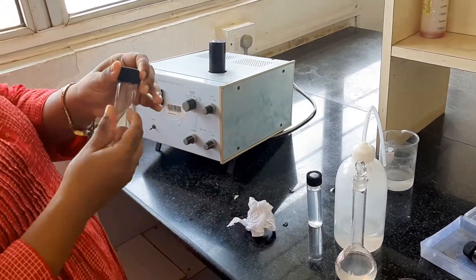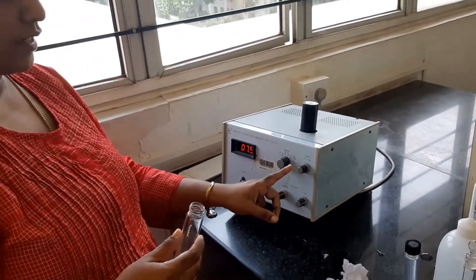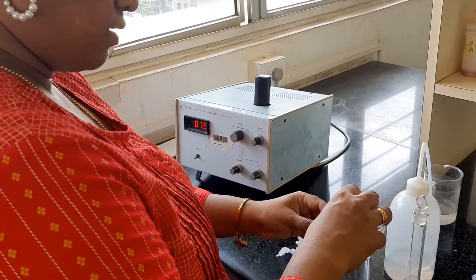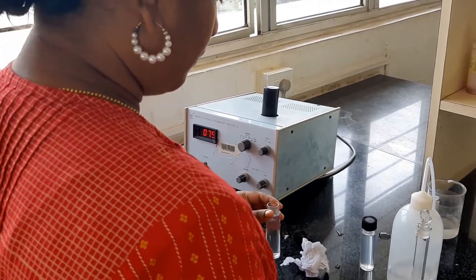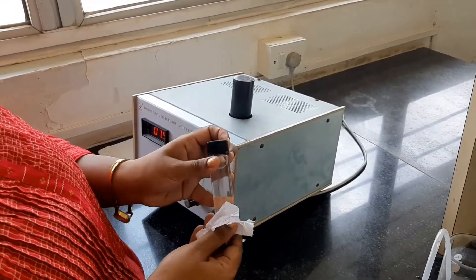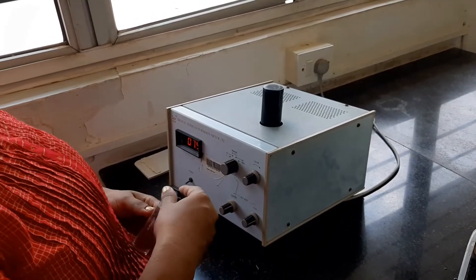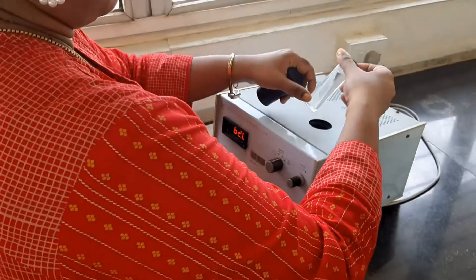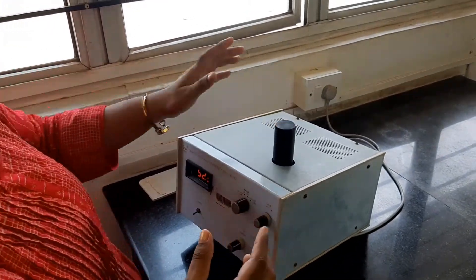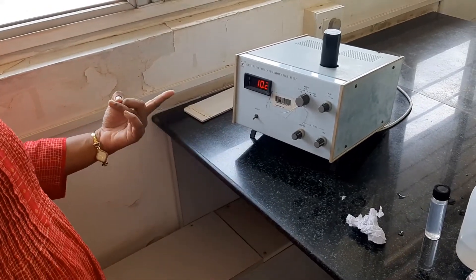Now I will keep the unknown solution. For calibration, setting at 0 — I have to fine tune it here. I have adjusted it. Now I am just going to keep the sample and take down the value. The turbidity of the solution is 10.2.